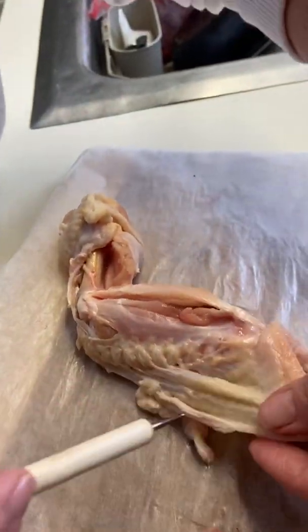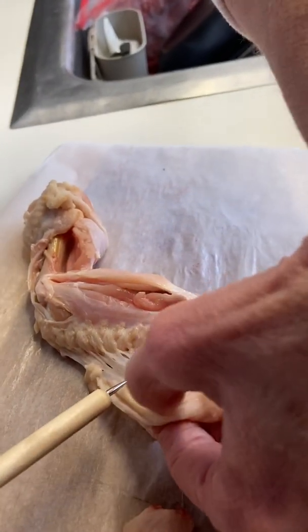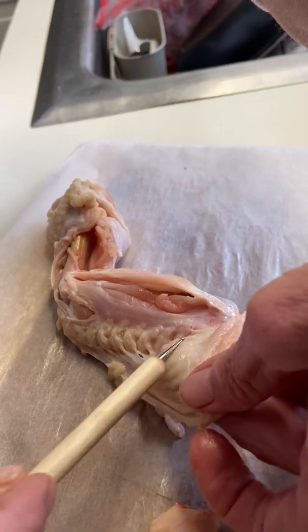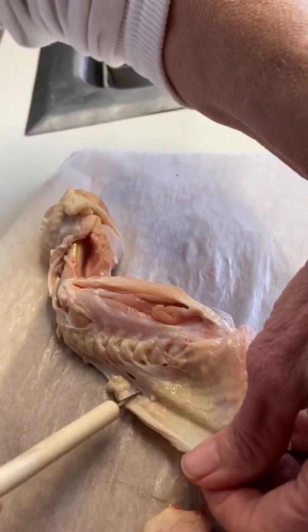Next on the list, I'm going to pull the skin back again just to identify the adipose tissue. And the adipose tissue is actually on the undersurface of my skin, and it does have that grease-like feel. It's also attached to this muscle here a little bit, but it is yellow in color, and my pointer is just kind of scrubbing across that right there.